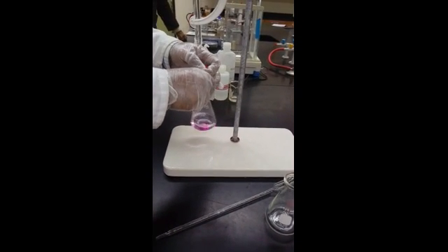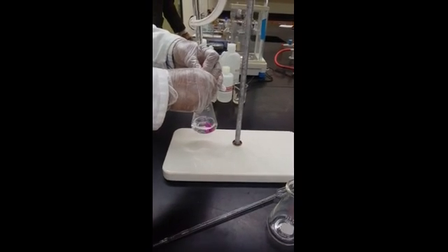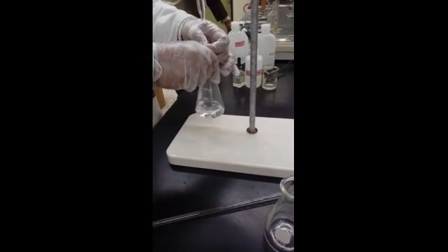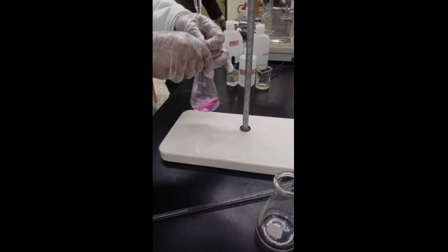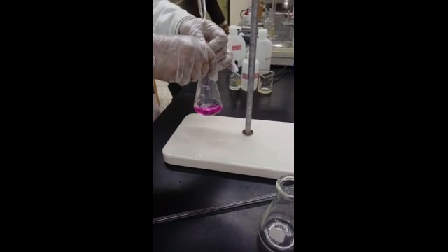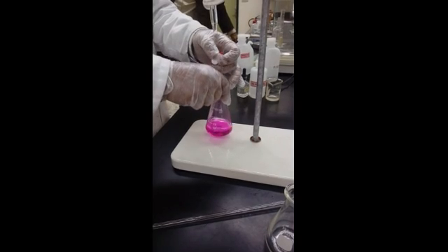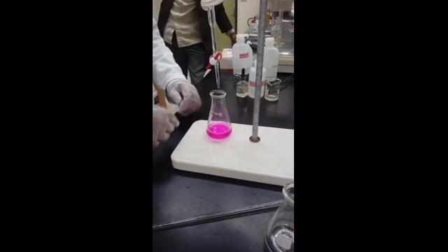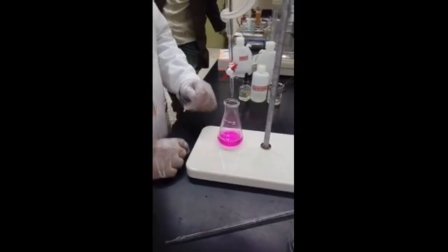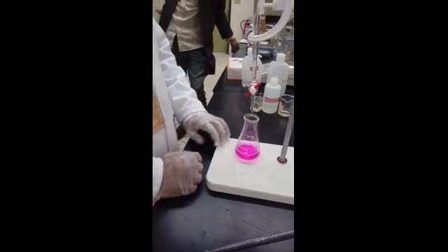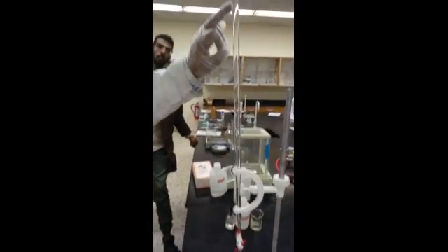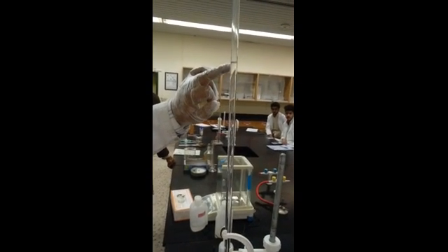So what does it mean? There is still acid. So you did not reach the end point still. Okay. Now what happened? So color remains. That means an extra drop of NaOH changed the color of indicator to the pink. So you have reached the end point. Now what you have to do? You have to go and take the reading, the burette reading.